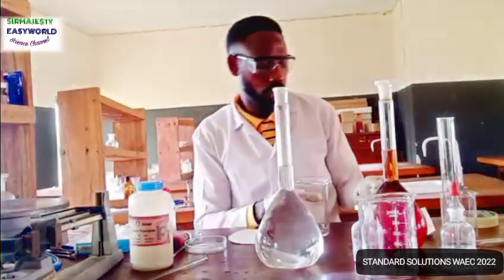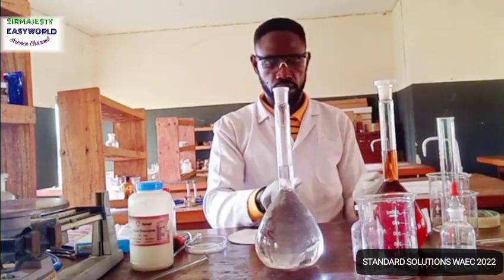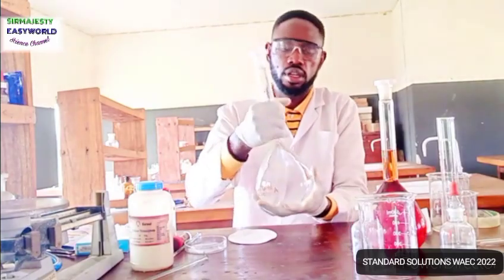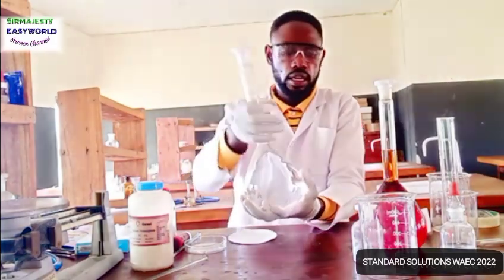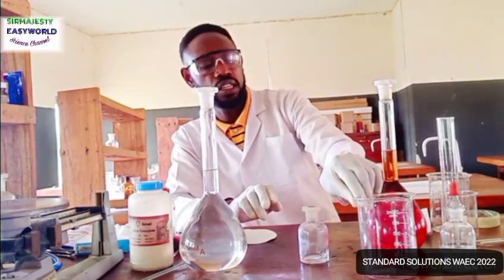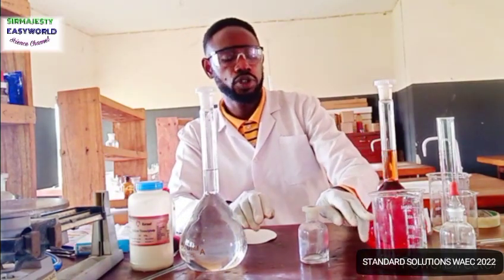We are there. Avoid error due to parallax. Read exactly at the meniscus. So solution B is here, and our job is done. So that is the first step. Then the second thing is, what must you now do?